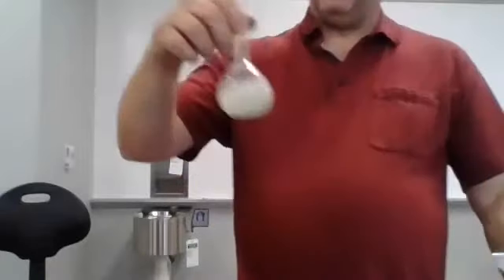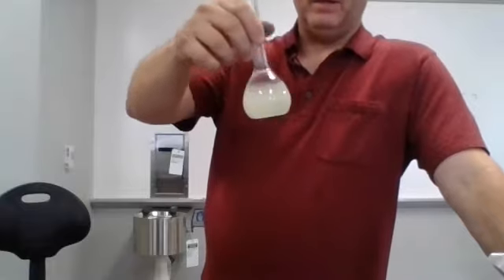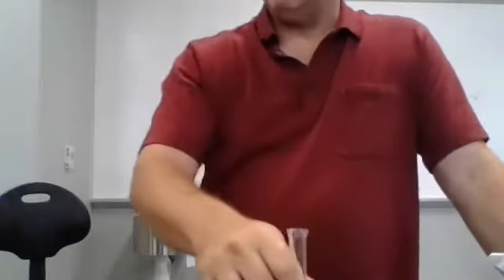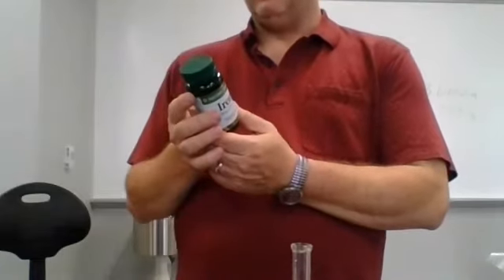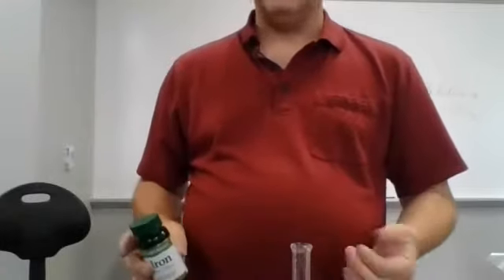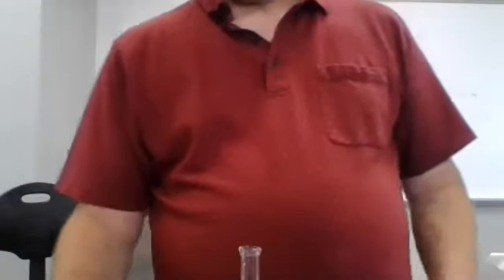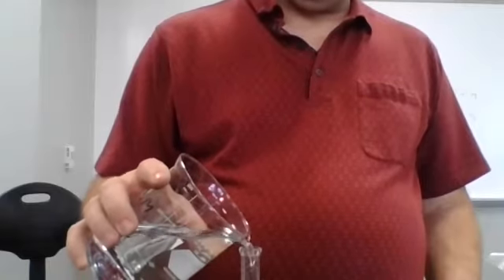You might also recognize how I have this iron tablet here. And this iron tablet has a bunch of cloudy stuff in it. Now, is that all going to dissolve? Probably not. There's other stuff. If I look on the bottle, I am going to see that there are ingredients. You know, I've got dried ferrous sulfate, but I also have things like vegetable cellulose. That's not going to dissolve. Okay, so I'm going to have some things in here that don't dissolve. I am again going to fill that to the top and then mix it well. I'm also going to let it sit to the side while I do some other mixing, but we'll come back to that. And this is our iron tablet.